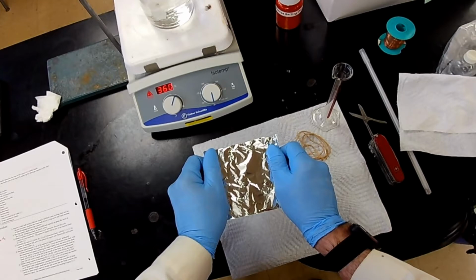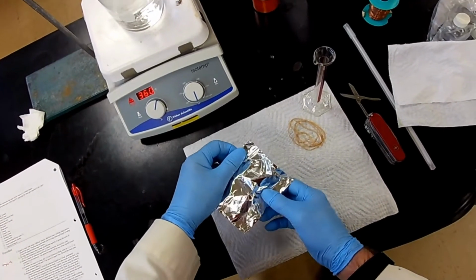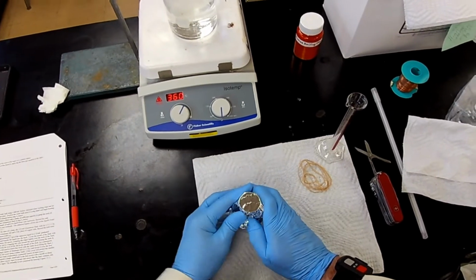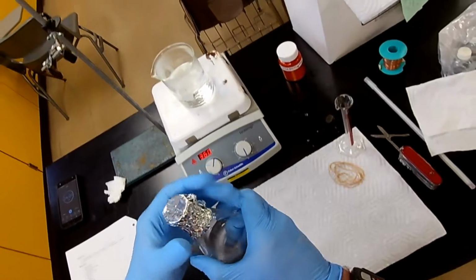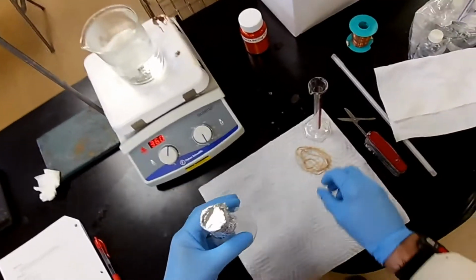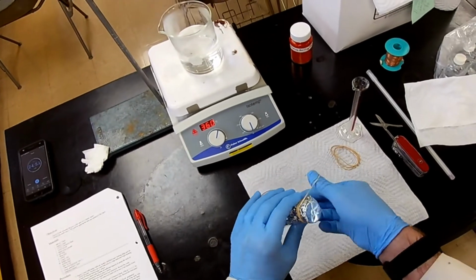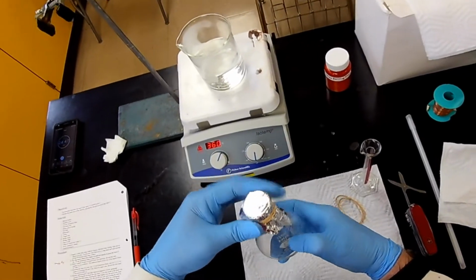So now we need to cover all this. Well, I didn't plan on that breaking. Cover this and that there. Hopefully, we'll pay it very close attention after this and be sure we've got all the moisture removed. All right. So there we have our flask.